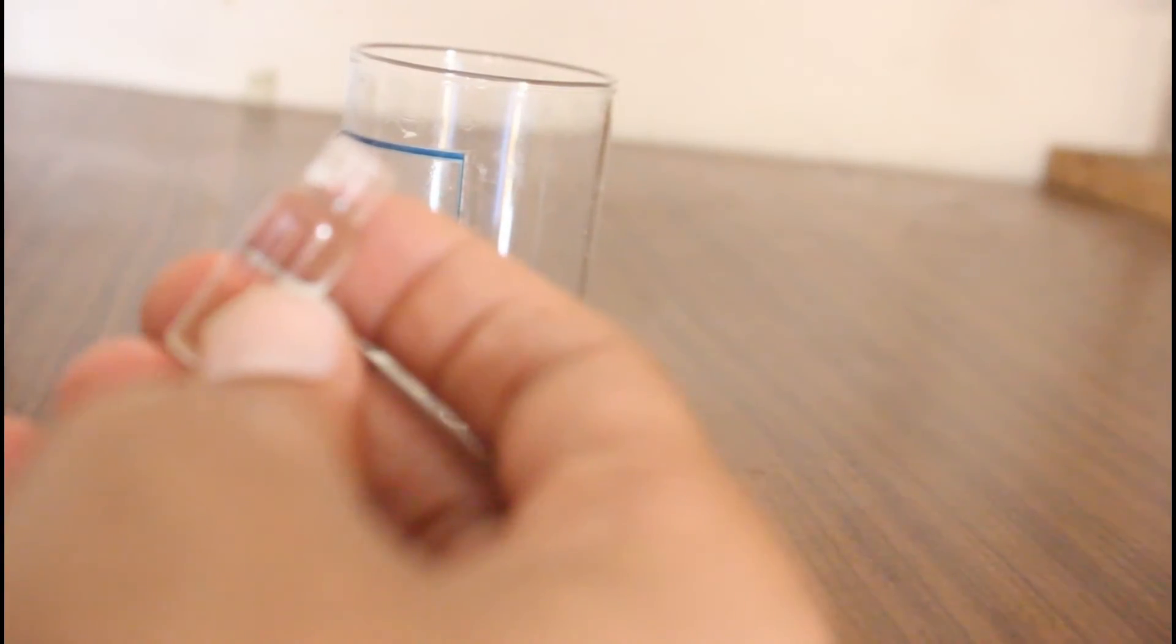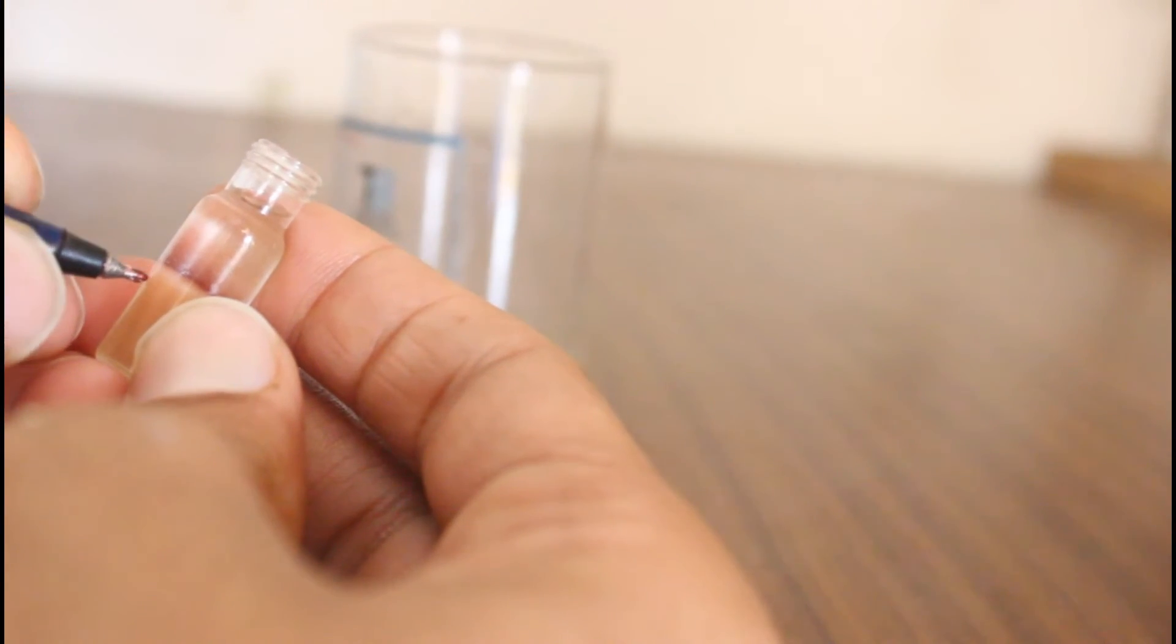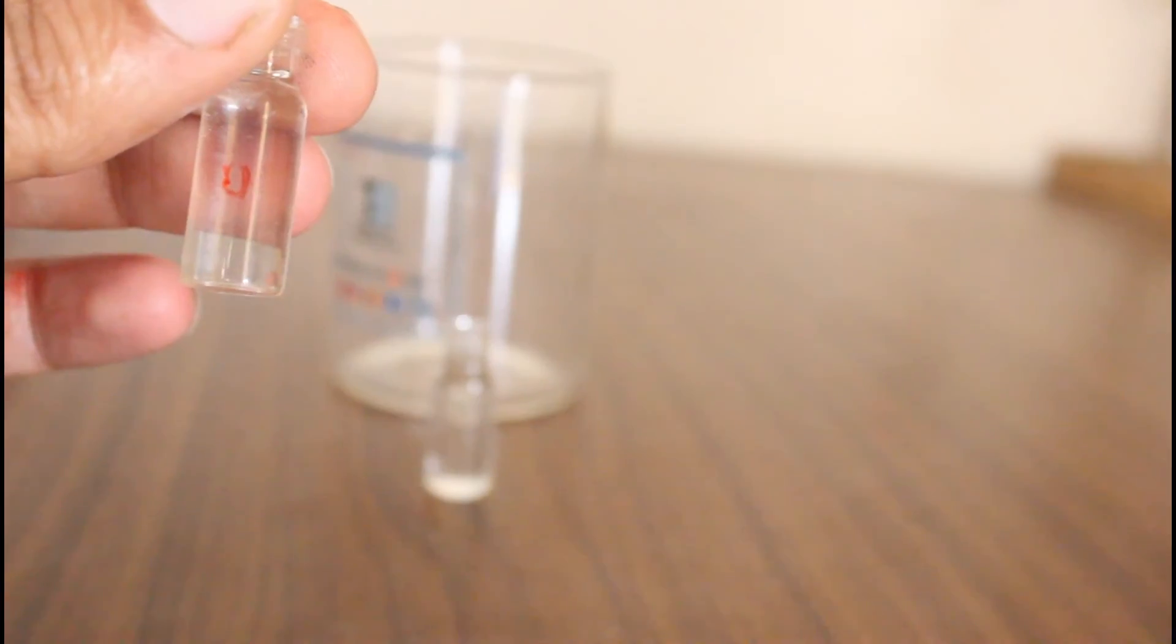So here we got these two samples. One of them is oily and the other is something like water. Let us mark it as U for upper layer and L for lower layer. The upper layer was oily and the lower layer was water.